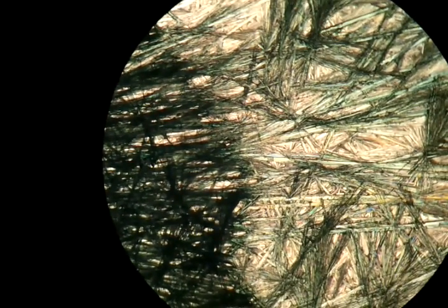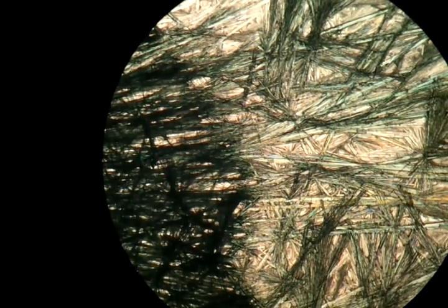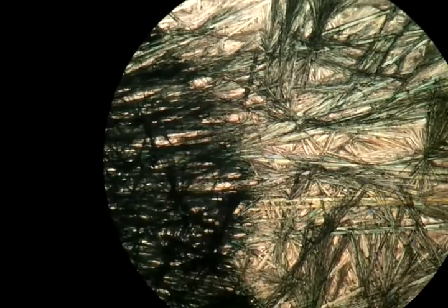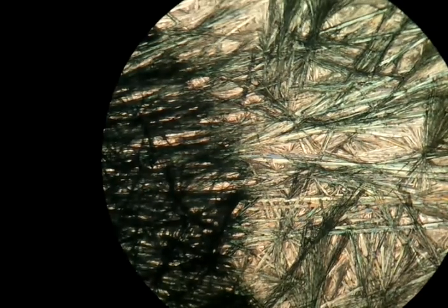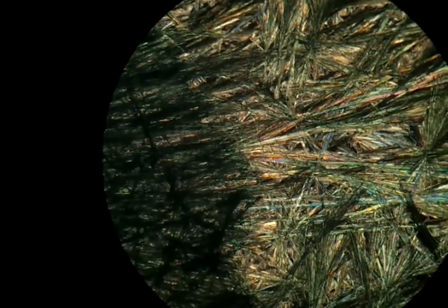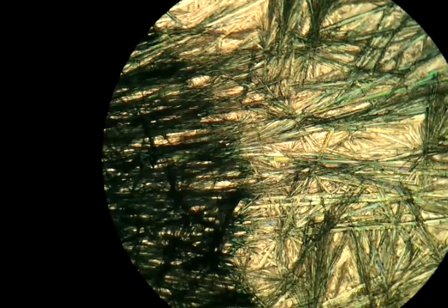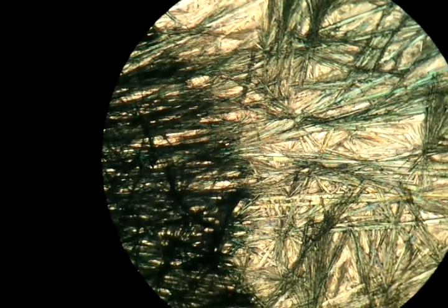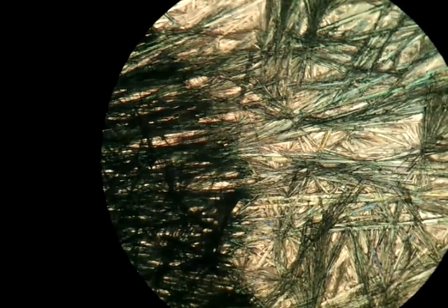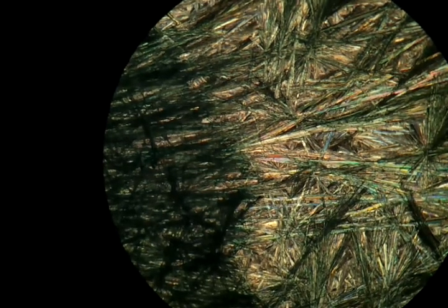Here are some colored crystals. Just to show the difference between polarized and non-polarized light, I'll turn the polarization filter now. This is the darkest point. Now it goes lighter again. Going back to the darkest point. Interesting to see how the red only shows up at the darkest point, with the blue and the greenish.